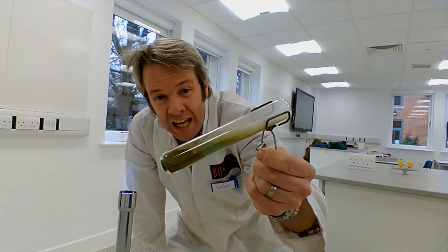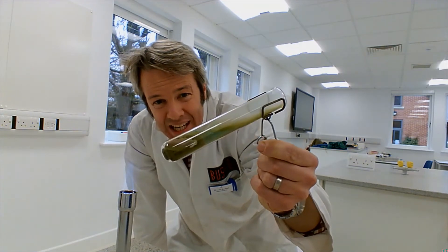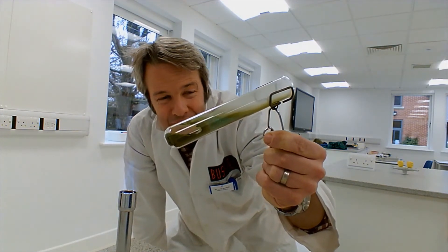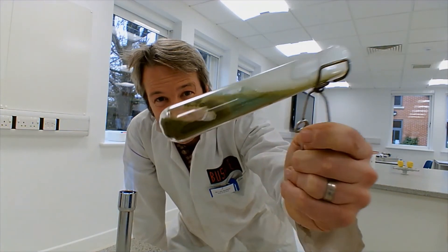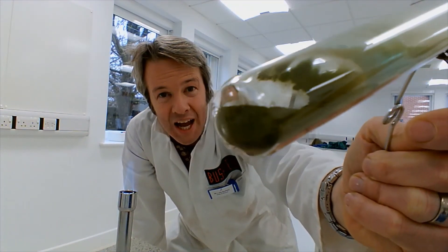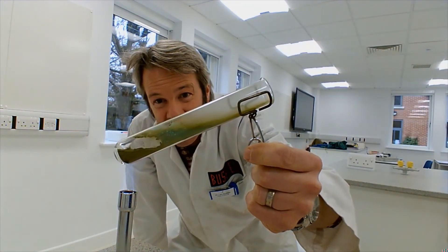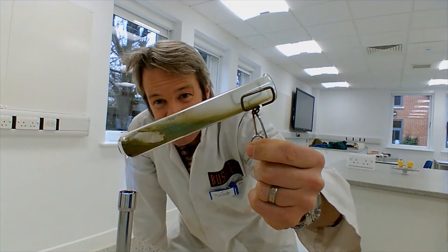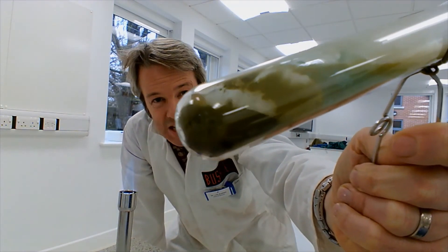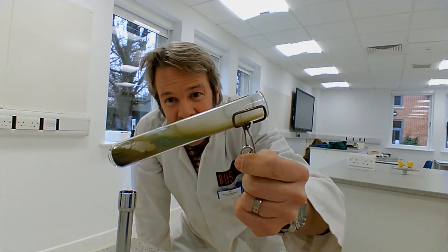It's forming a gas. If we were to record the mass at the beginning with our copper carbonate — look at the gas coming off, that bubbling — and then record the mass at the end of the copper oxide, you'd find the mass is less. The mass is less because you've lost the mass of the gas as well.